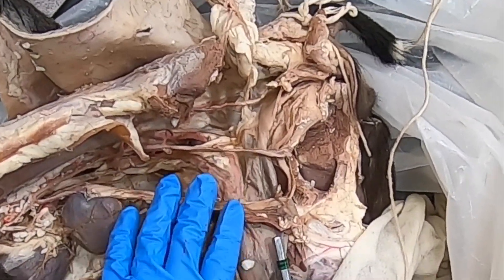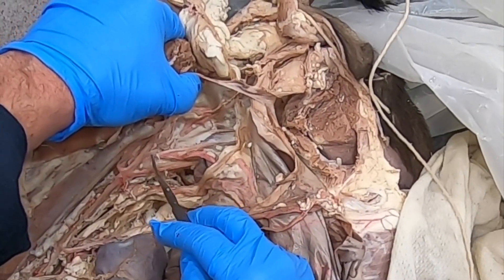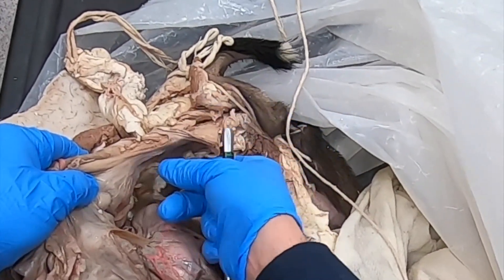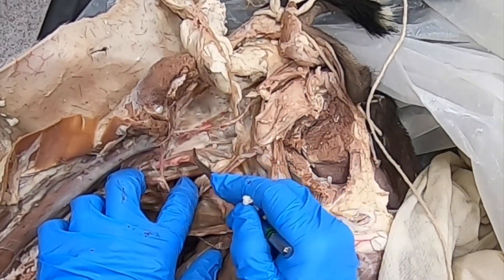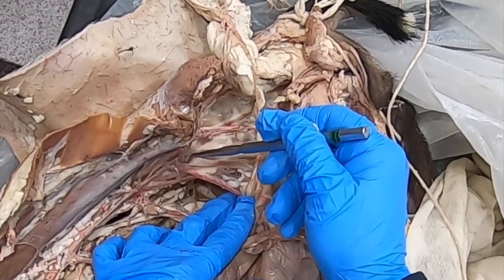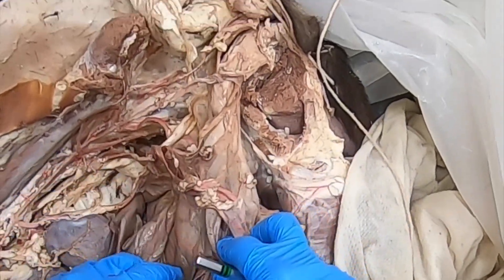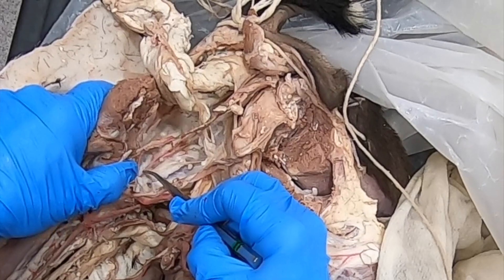Here's another pregnant uterus specimen that nicely shows the blood circulation. We can see the internal iliac artery giving off a structure going into the lateral ligaments of the bladder — that structure is the umbilical artery. Coming off the umbilical artery is the main supply to the uterus: the uterine artery. We're also going to have a uterine branch coming off the ovarian artery as well as a uterine branch coming off the vaginal artery.